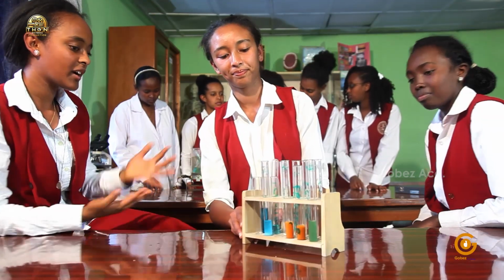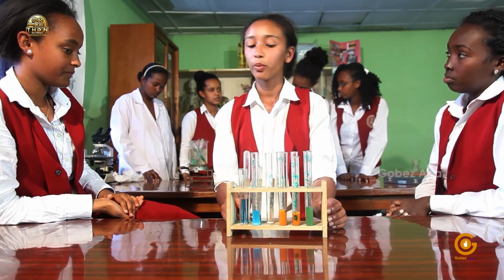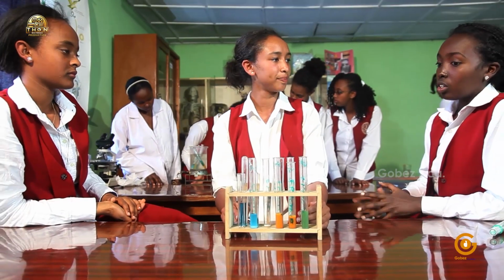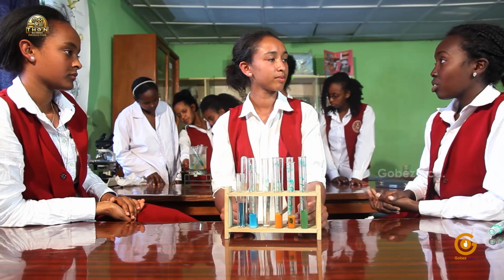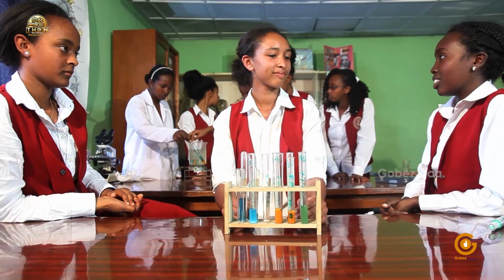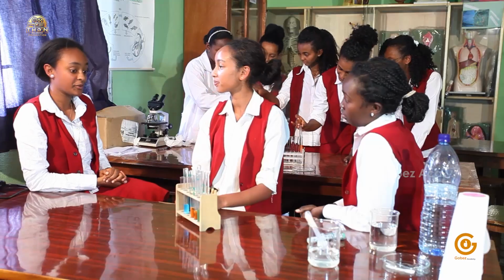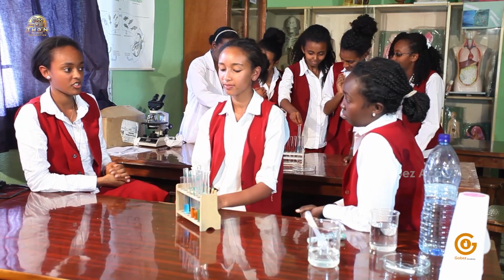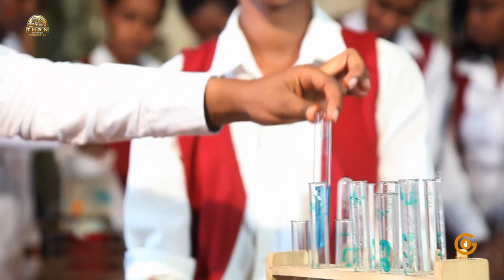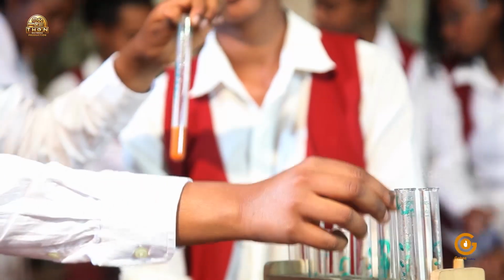So what kind of conclusion can we make after this? Well, we know that all 4 of these are carbohydrates. We have to see what is common for glucose and fructose. How are they different from sucrose and starch? Glucose and fructose are monosaccharides. By the side, sucrose is a disaccharide and starch a polysaccharide. Well, so I think we can conclude and say that monosaccharides change the color of Benedict's solution, which has a blue color, from the blue color to orange, just like glucose and fructose did.